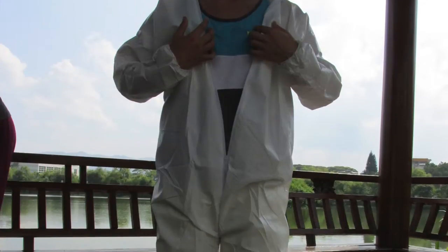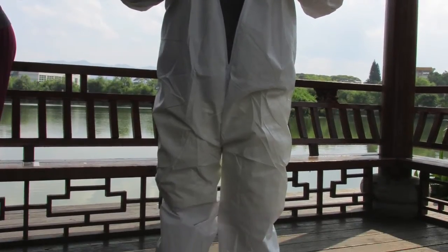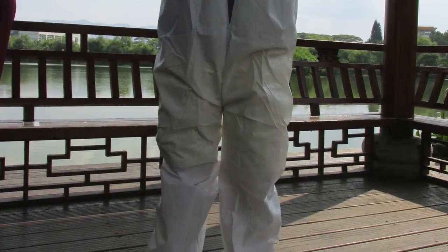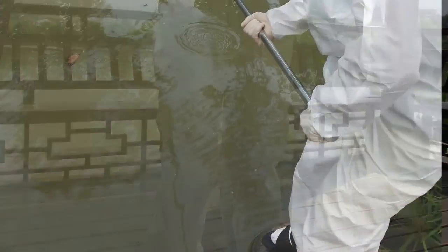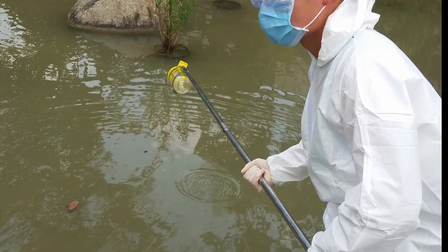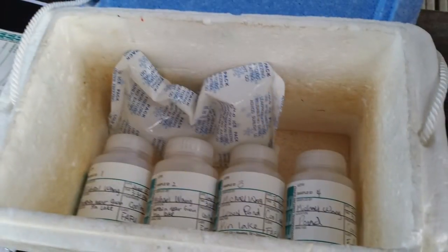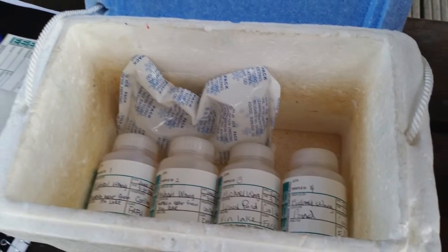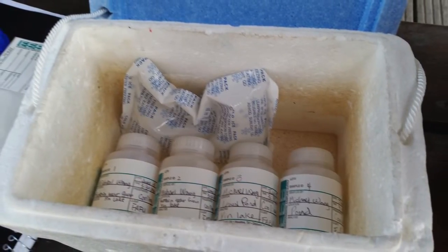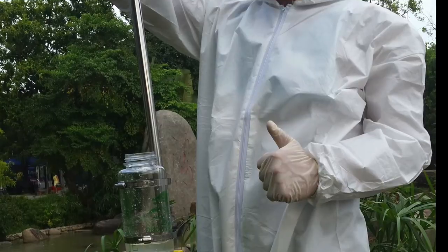The equipment that is going to be used to complete this sampling collection are a full body protected suit, gloves, face mask, a dipper, close-toed shoes, glass containers, a cooler, and chain of custody sample labels.